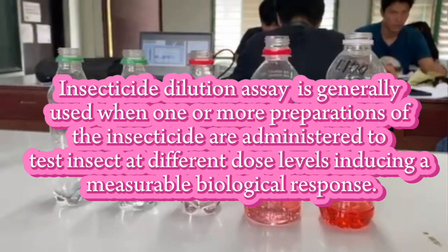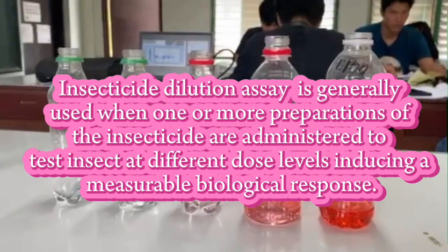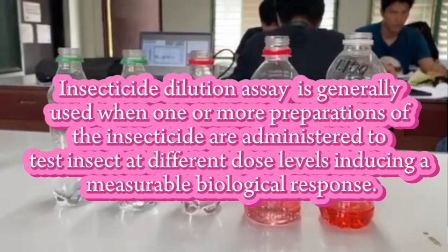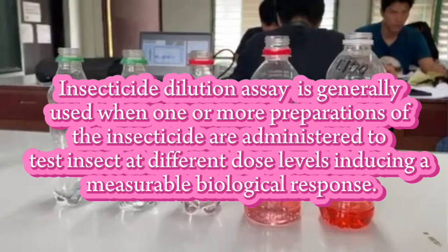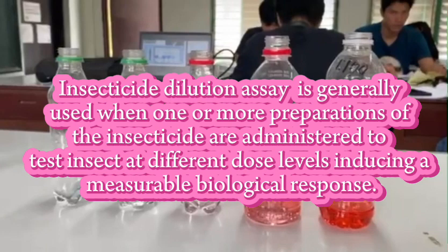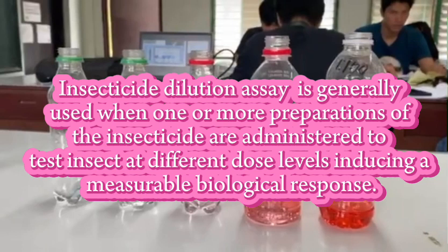So, insecticide dilution assay is generally used when one or more preparations of insecticide are administered to test insects at different dose levels, inducing a measurable biological response.